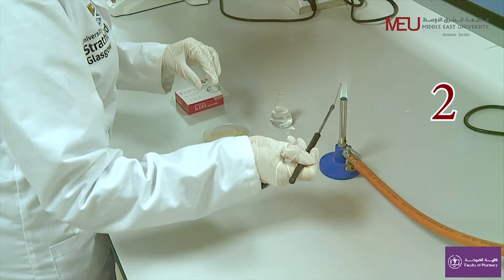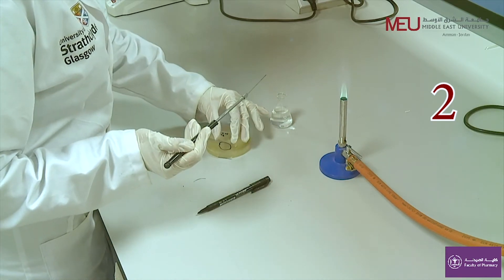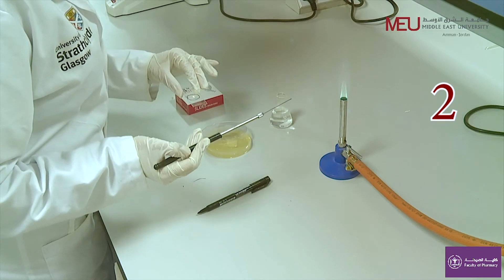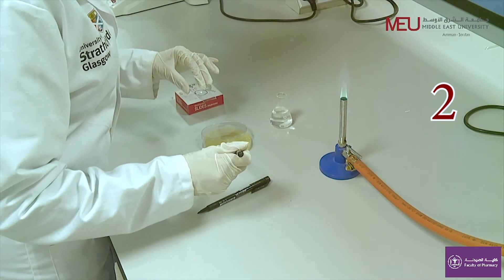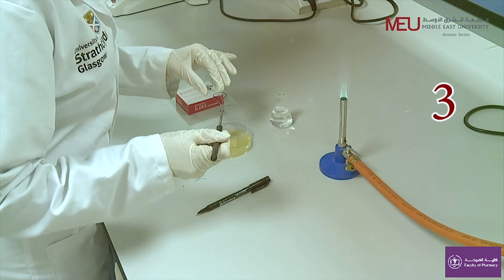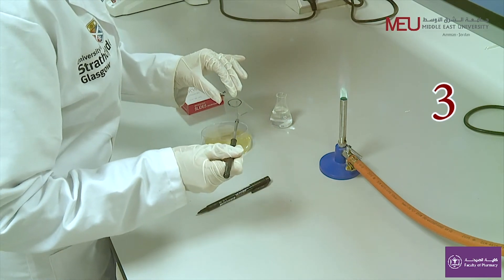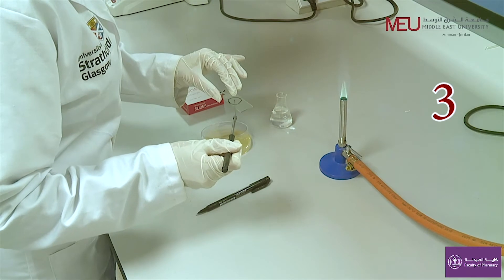Remember to allow the inoculating loop to cool for approximately 30 seconds without touching it so that bacteria picked up won't be killed. Gently mix the loop of bacteria in the water drop to emulsify and spread on the slide.